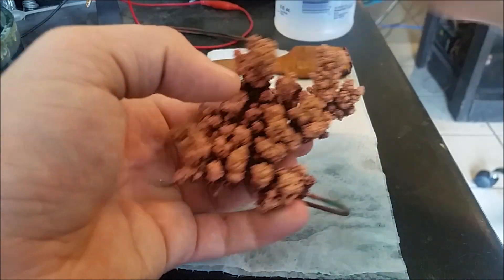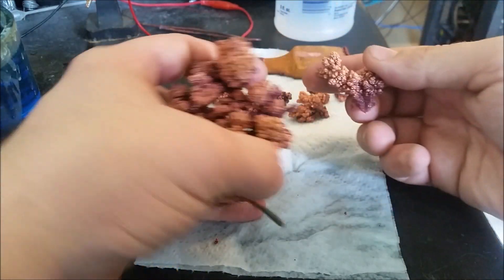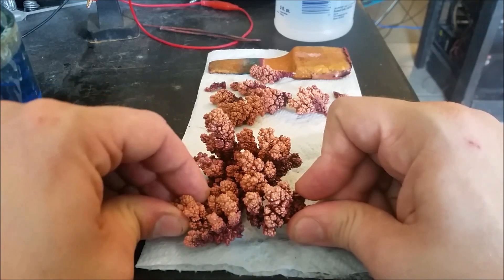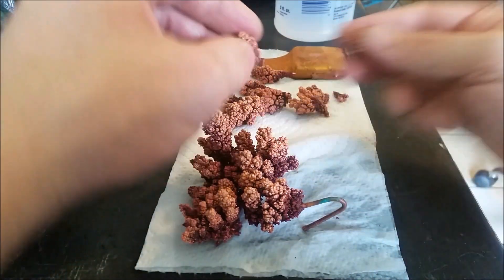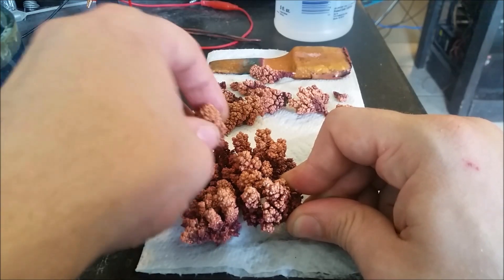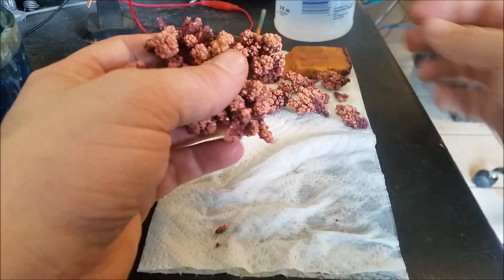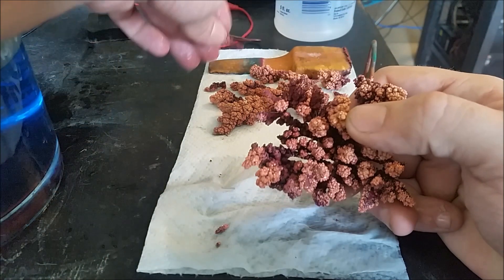You see some of them just crumble on you. Now all of these really small ones are the ones that crumble — I usually melt those down into a brick and keep that as a pure ingot of copper. These big ones though, I like to keep as crystals. Sure, you can melt the big ones down too, that's not a problem, but I think they're much more beautiful this way.